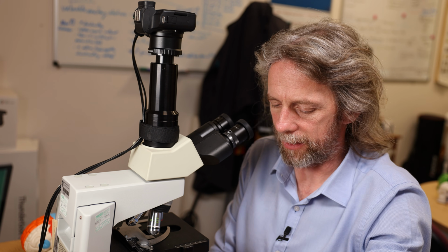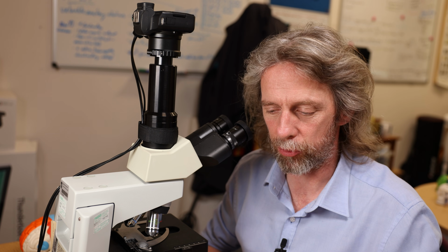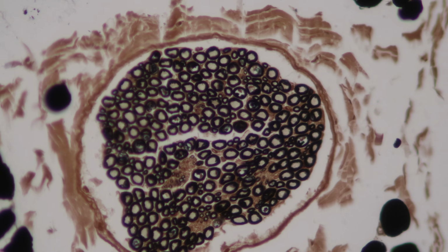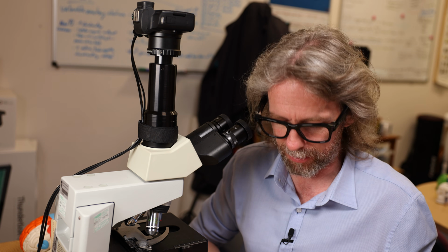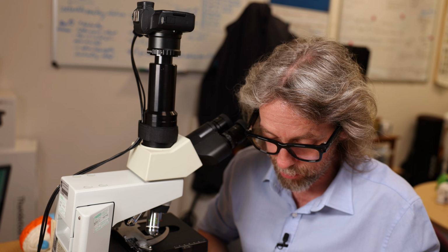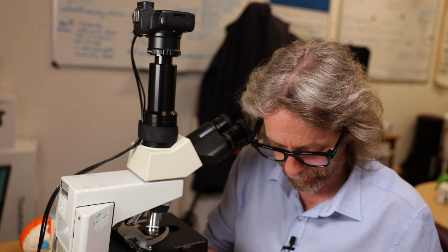When we were looking at the peripheral nerves, I think they were stained with osmium tetroxide, which is great for looking at lipids, so we could see the myelin in the peripheral nerve. We could see those rings, and it was very, very distinctive. Silver stain is great for staining neurons, so then you could see all those dendrites and axons and what have you. I've got some slides here. Again, I know nothing about them other than what's written on the slide, and they're big.